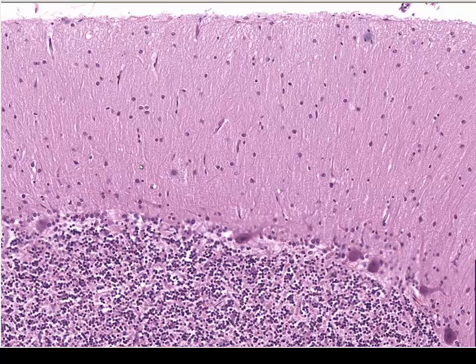Now, from our lecture podcast, you should easily recognize where we are in this particular organ histology slide. You shouldn't take a moment's hesitation to know. You see three layers: a sparse outer layer, a very highly populated inner layer, and then this interface layer with these huge flask-like cells. What are we looking at? This is cerebellar cortex. And we have the molecular layer, the granular layer, and then these are the Purkinje cells of the Purkinje layer. Those help identify this as cerebellum.